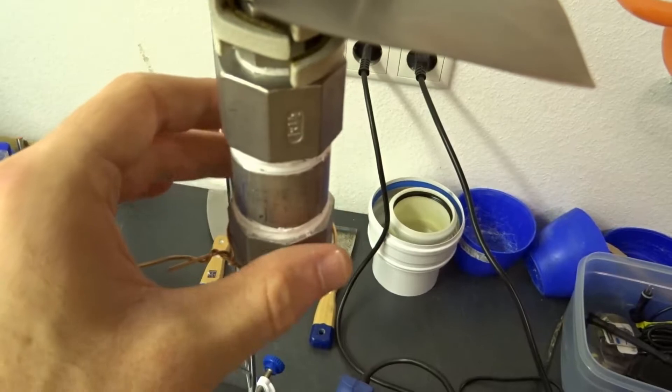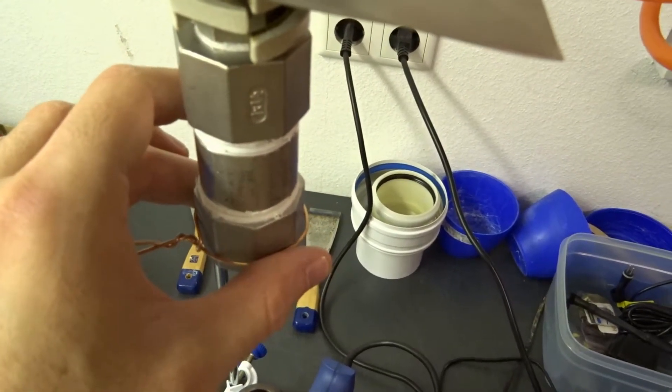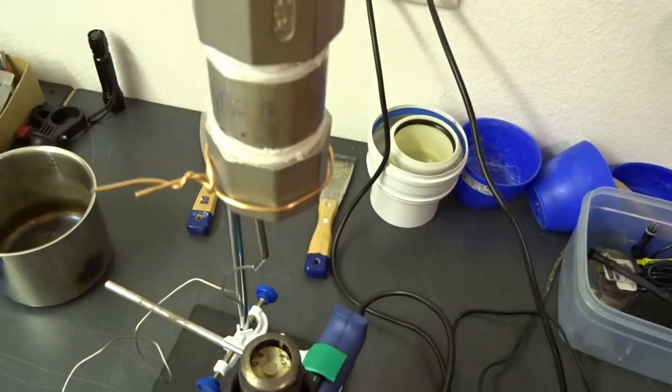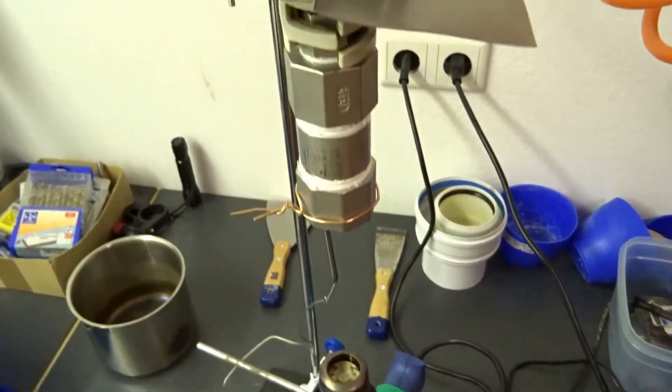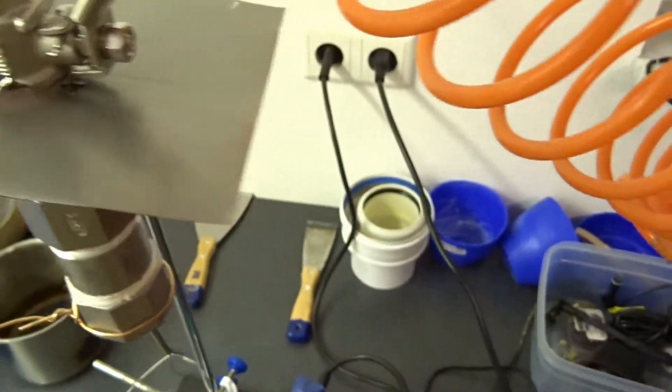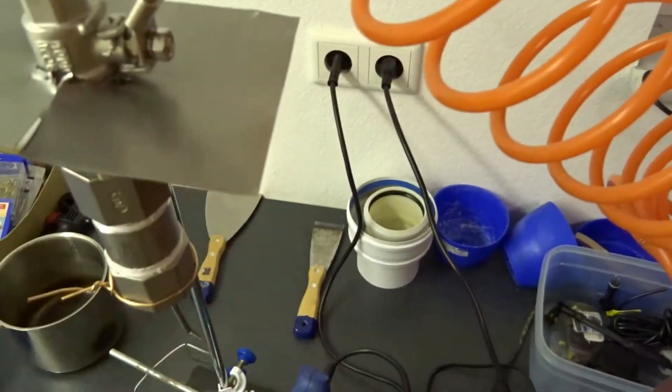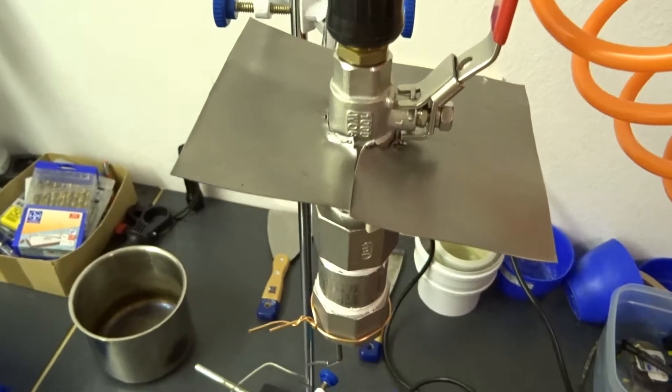Currently this is at around 50°C and that is warm to the touch, right? So I'm going to turn on the heating and then we will see how it goes. This should stay cool, this should not melt. But my little heat shield is hopefully doing well.